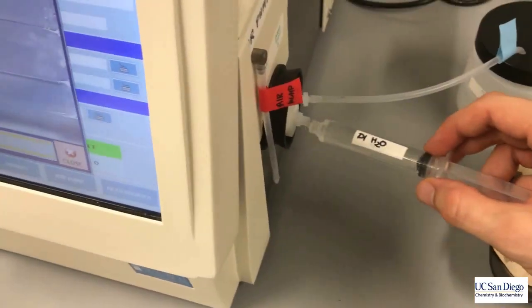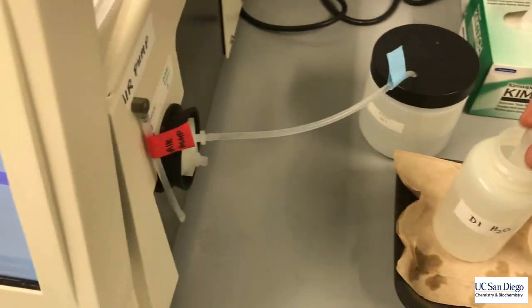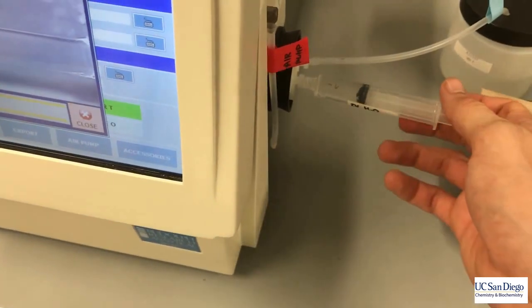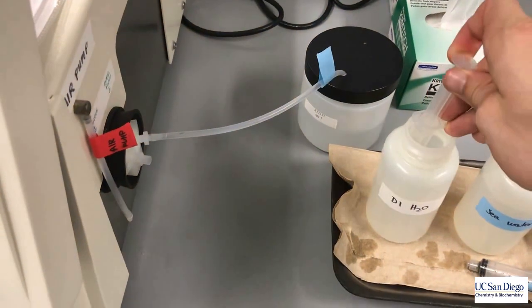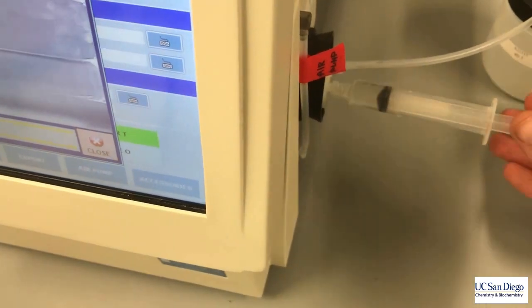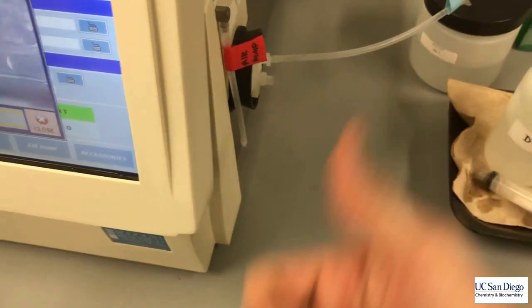When you finish your measurements, make sure that you wash the U-tube with DI water three times to ensure that the U-tube is conditioned for the next user.